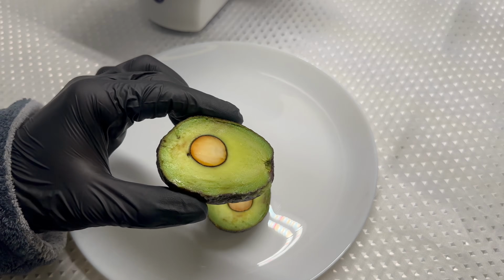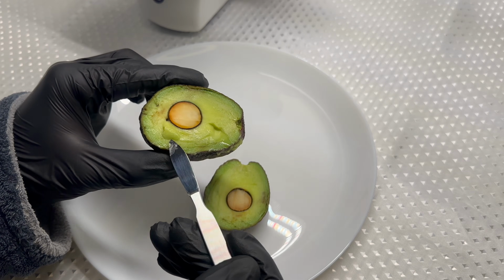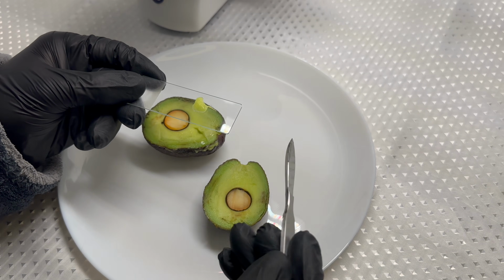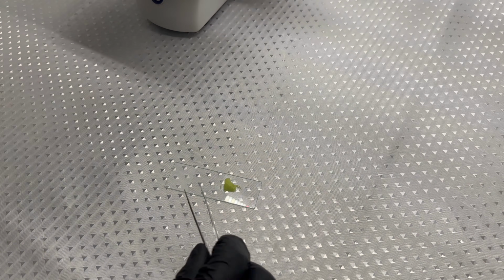We are very familiar with how avocado looks and feels. Soft, creamy, and easy to spread, its texture is instantly recognizable. But while avocado is a common part of everyday meals, few people ever think about what it looks like on the inside. At a microscopic level, what gives avocado its smooth consistency?